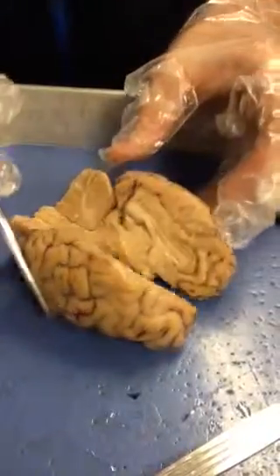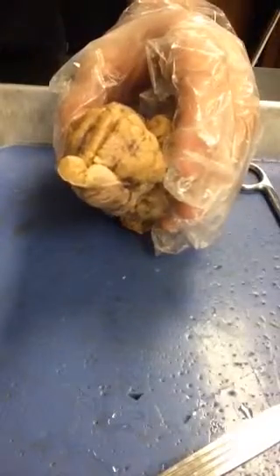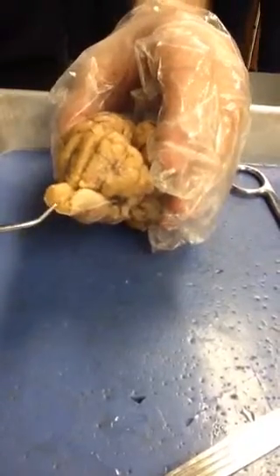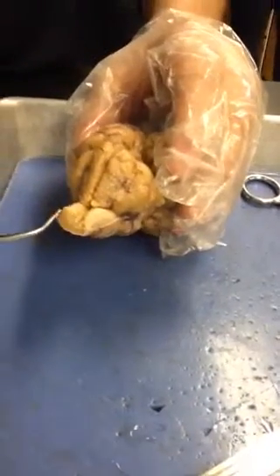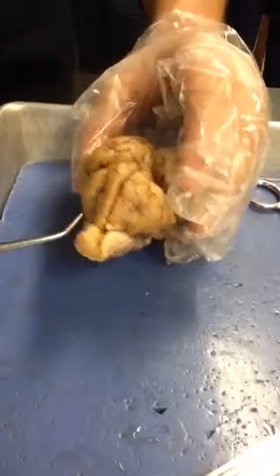And right here inside the brainstem of the medulla oblongata, we have our white matter and gray matter. Our white matter acts as our cables that go with the gray matter right inside. Obviously it's been cut so you can't really see it perfectly, but on the very inside is our gray matter, and that acts as our computers on the brainstem.